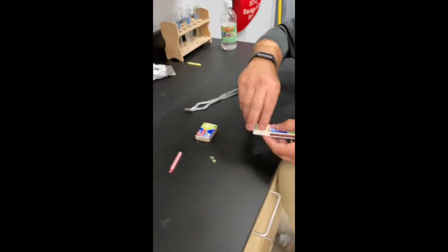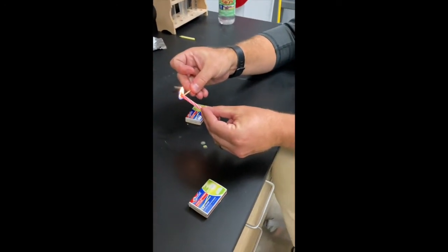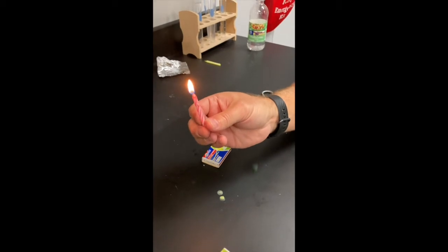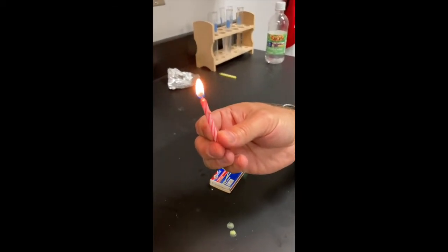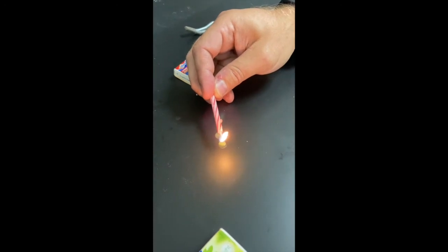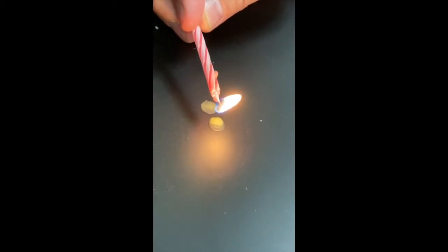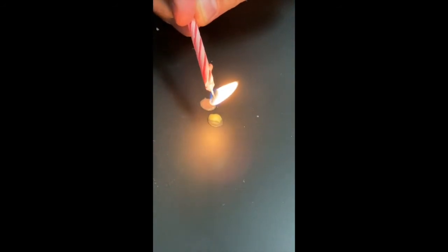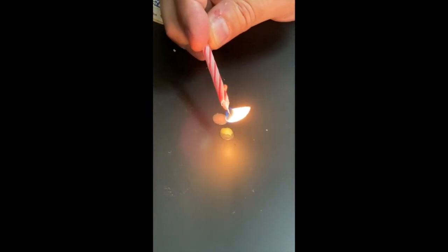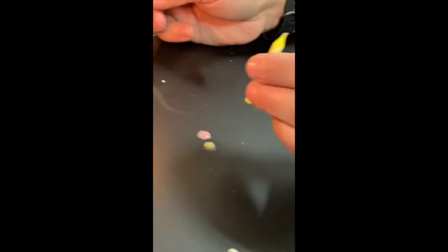So first thing I'm going to do is light a match, then I'm going to light this candle as quickly as I possibly can. And then as you see the candle lit, while the candle's lit, is this a physical change or a chemical change? Now, what I'm going to try to do is get this wax to drip off of here. You can see I have a little bit of dripping, but that's going to help me with the next part. One more drop should do it. Hopefully. Again, as you're watching this, you have to consider physical change or chemical change, and evidence would go a long way on this. So let's see if that'll work here.